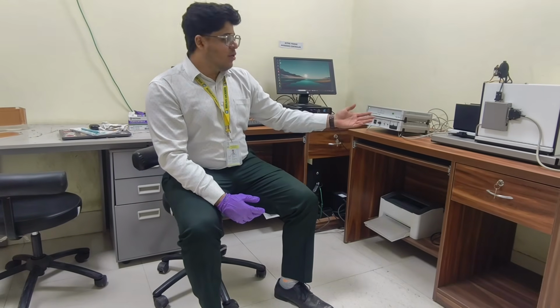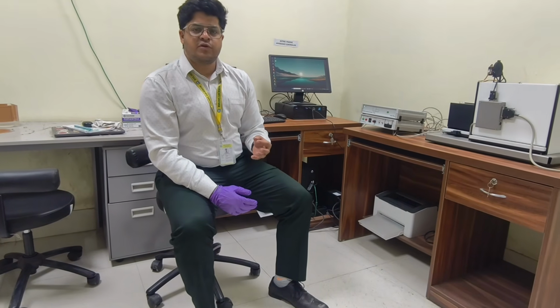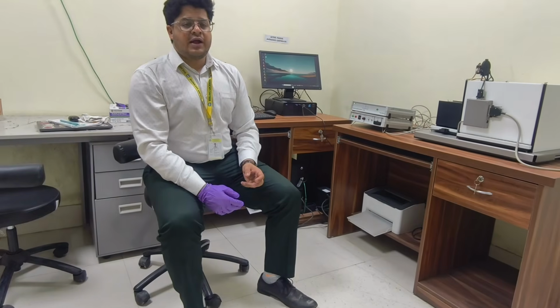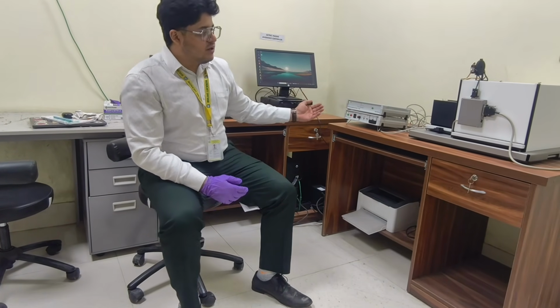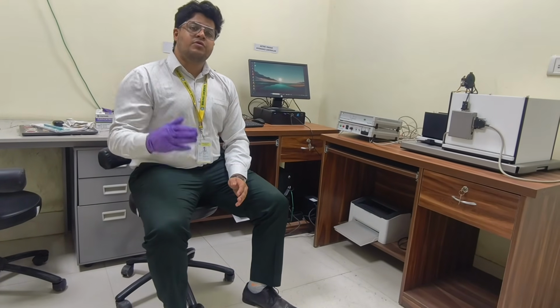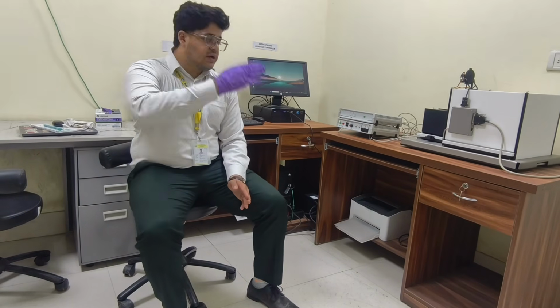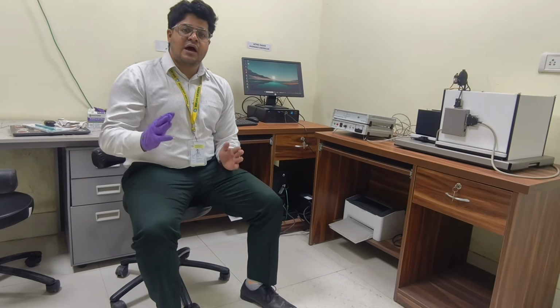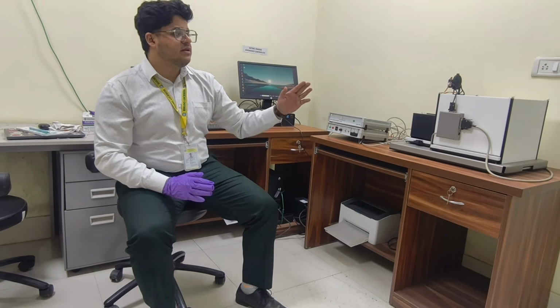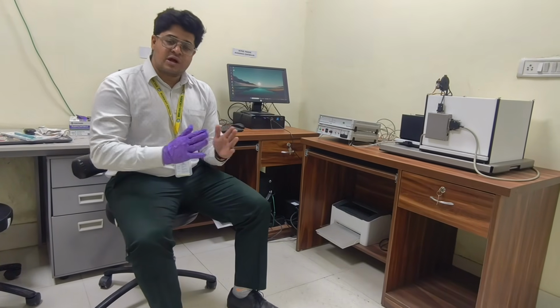After reaching inside the box, the gate was closed and an unpleasant stimulus, a 0.5 milliampere shock, was delivered to the foot, and that caused an unpleasant sensation. The rodent immediately came to the light environment. Now we give a rest period and we place the same rat again into the light environment, and now after the exploration time, we have seen that the latency period, the period needed for the rat to enter again into the dark environment, is now more.